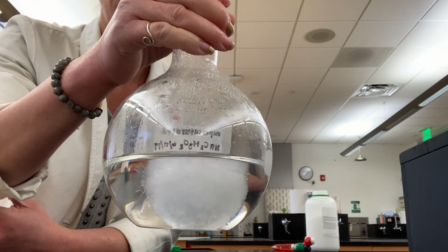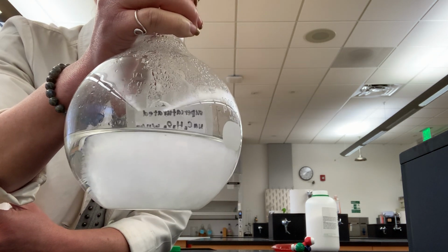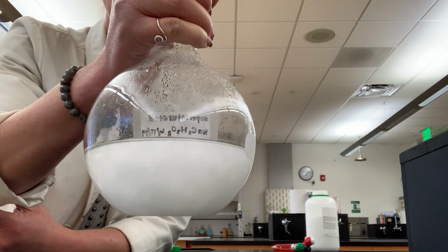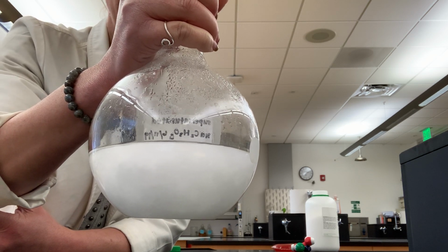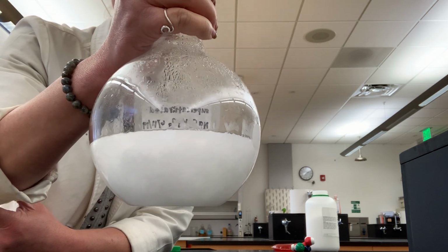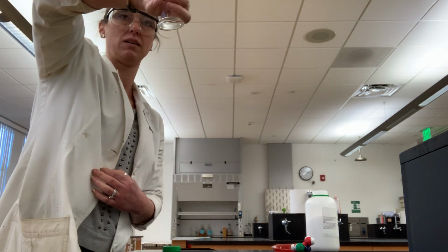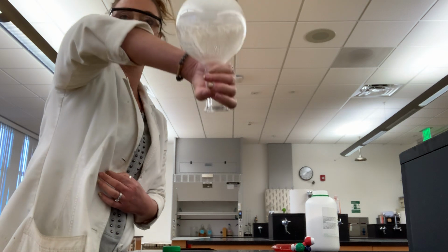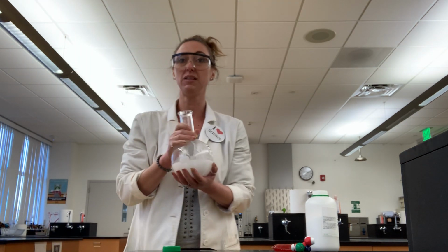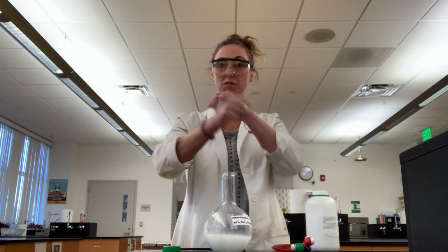You can see that all those molecules are starting to just grab onto one another, and they're crystallizing, they're forming back into a solid right before your eyes, back the way they're supposed to be in the solid phase at room temperature. And you can see there's no trickery here. Okay, this is a solid now.